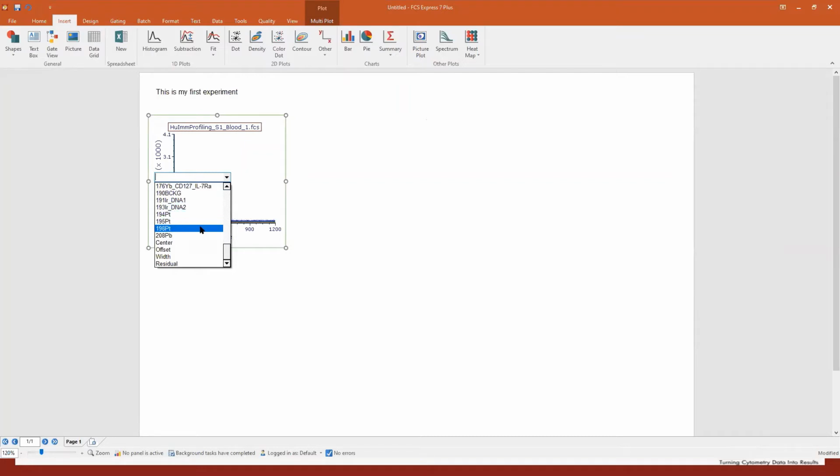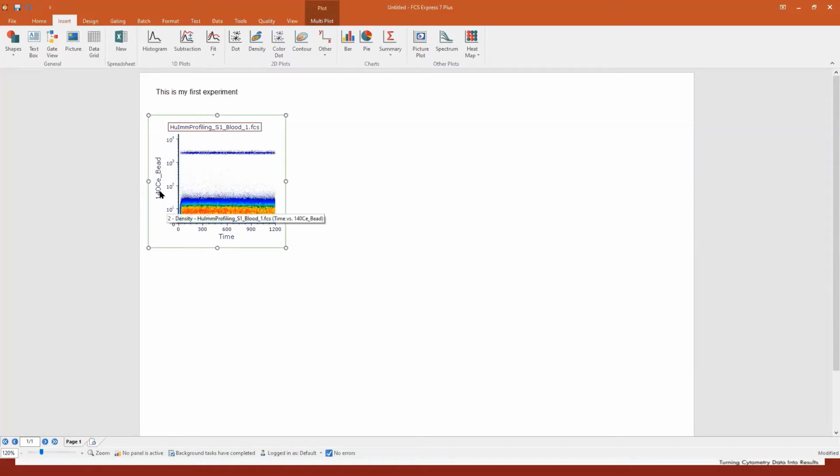It's really great because you can access a lot of markers here. Now, especially with this instrument, since you have a lot of parameters, it's good to know that you can type here. So for example, I can type bead and filter, and I can see all the parameters that include that word. So for example, we want to start with a cleanup gate, as we saw before, by displaying beads 140 and time on the x-axis.